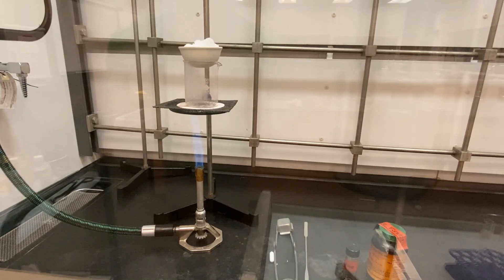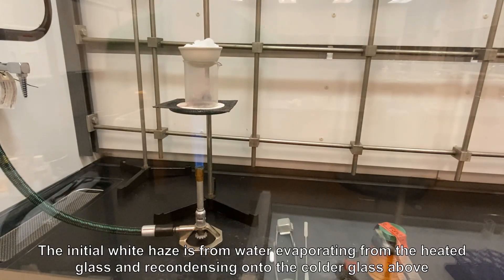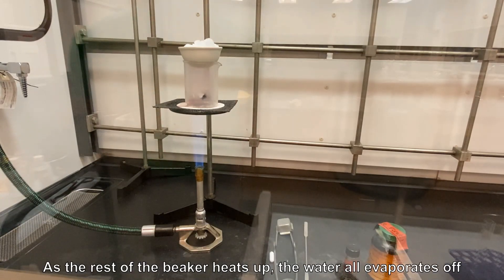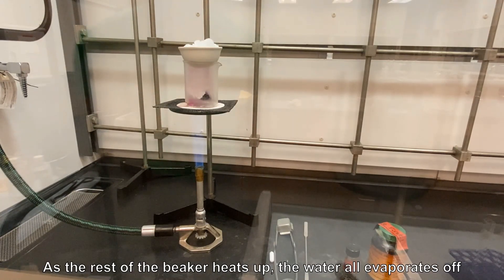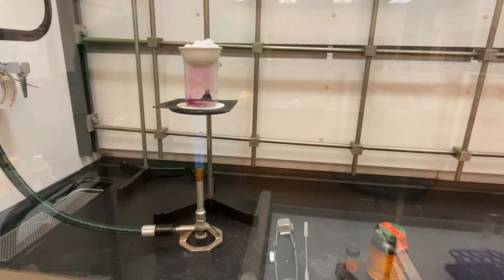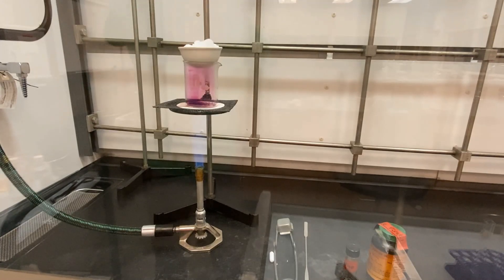Let's watch what happens as we heat the iodine in the beaker. First, we see a white haze inside of the beaker, and this is water evaporating. As the beaker heats up, any water remaining inside the beaker evaporates off. What do you see now?